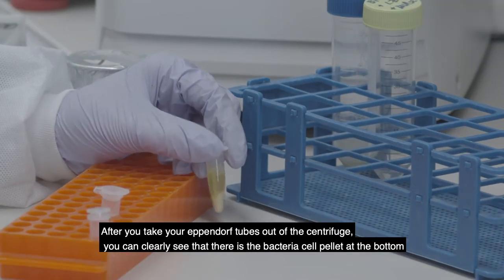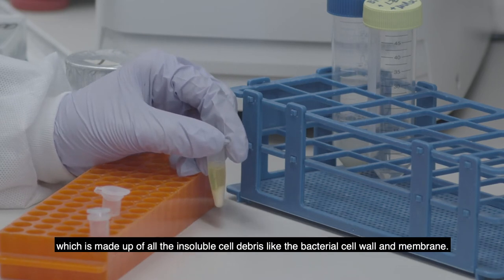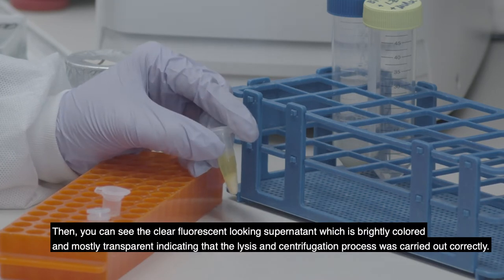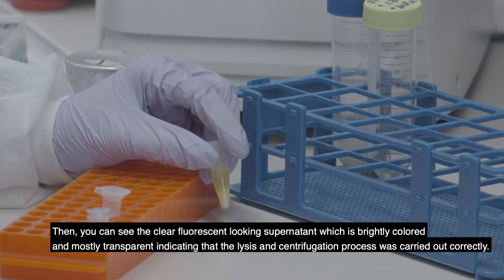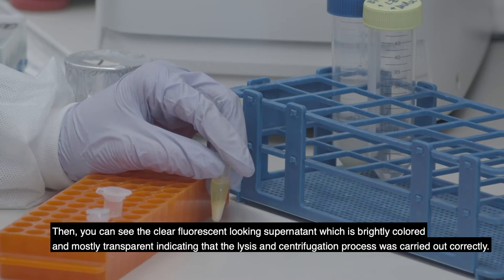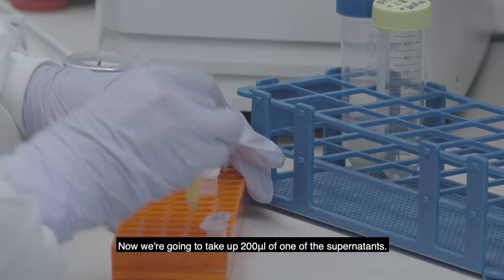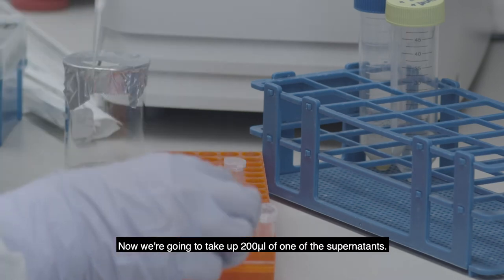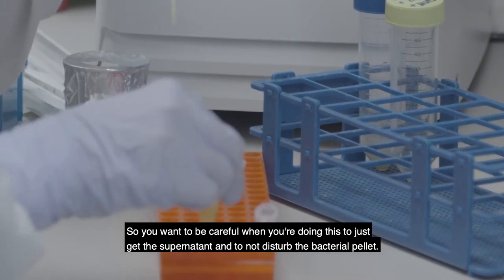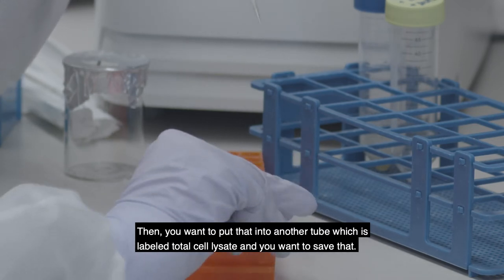After you take your Eppendorf tubes out of the centrifuge, you can clearly see the bacterial cell pellet at the bottom, which is made up of all the insoluble cell debris like the bacterial cell wall and membrane. You can see the clear fluorescent-looking supernatant, which is brightly colored and mostly transparent, indicating that the lysis and centrifugation process was carried out correctly. Now we're going to take up 200 microliters of one of the supernatants — be careful to get only the supernatant and not disturb the bacterial pellet — and put that into another tube labeled total cell lysate.